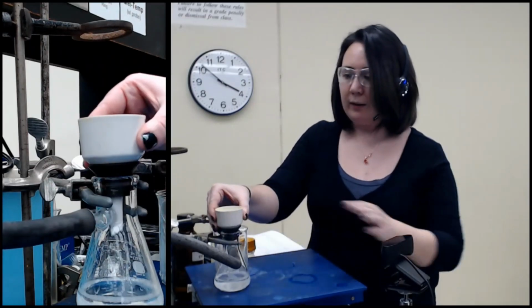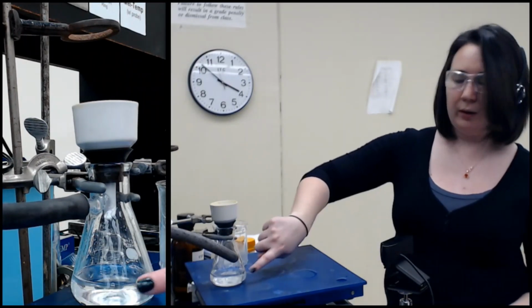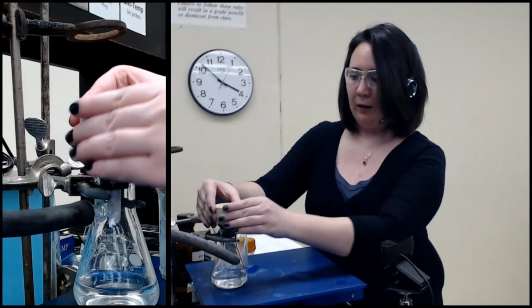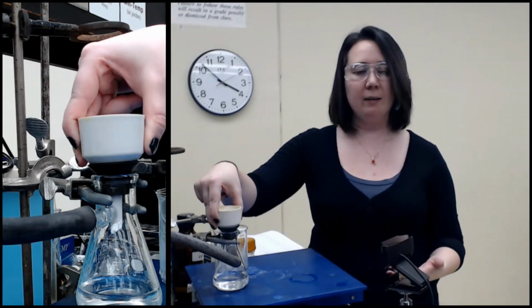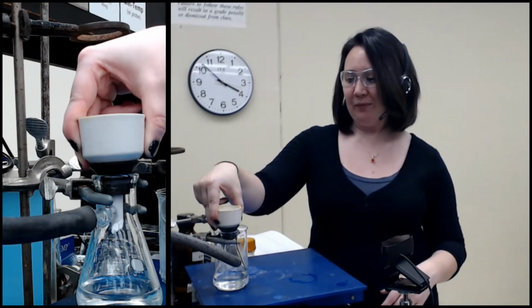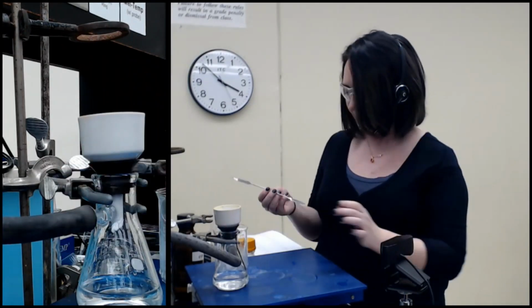Then what I like to do is let the vacuum run for a few minutes. First thing you can see, there is no solid in here, it's just clear liquid. All the solid is in here, so we didn't lose any in this step. It's pretty good. I like to let it go here because that helps it dry. I'm not going to take the melting point or the masses today. I'm going to come back tomorrow, weather pending. By then it should be dry, but because water is pretty difficult, I like to let it sit over the air stream for a couple minutes anyway.